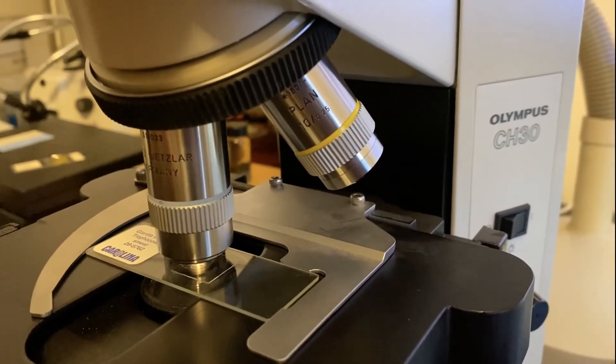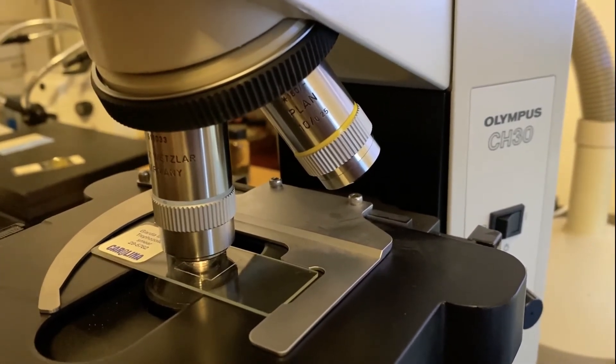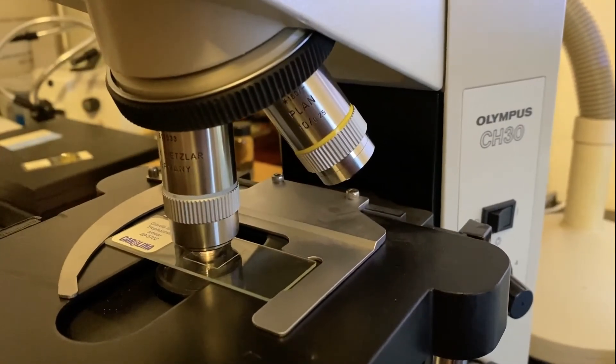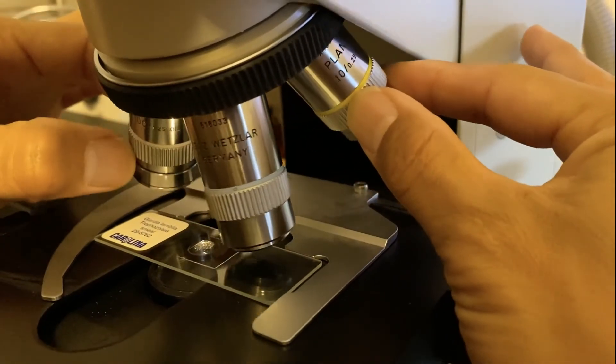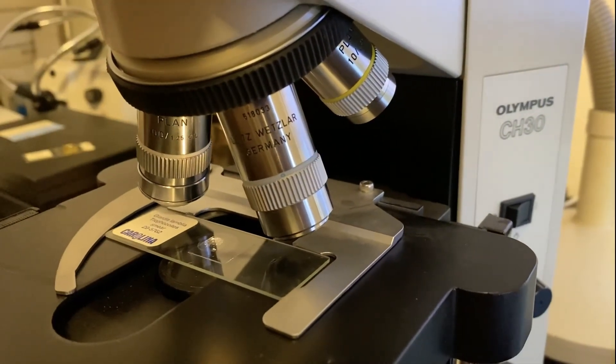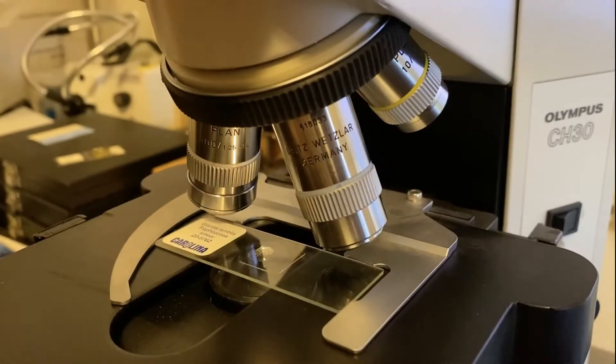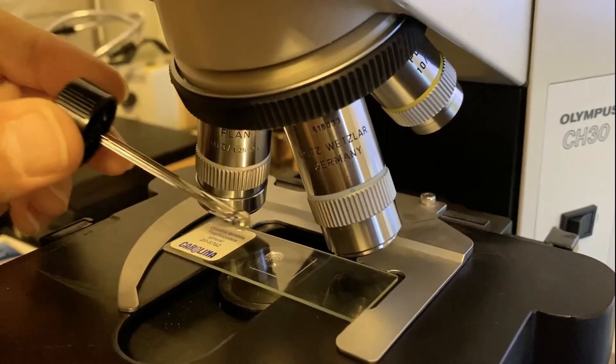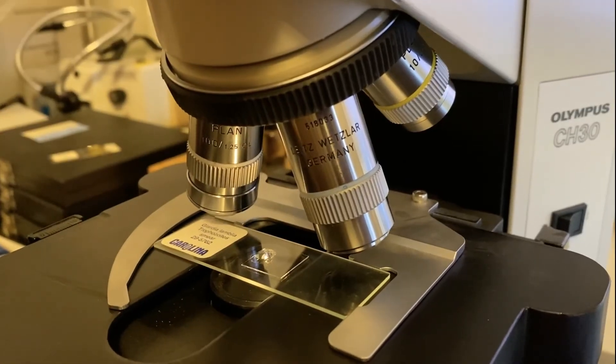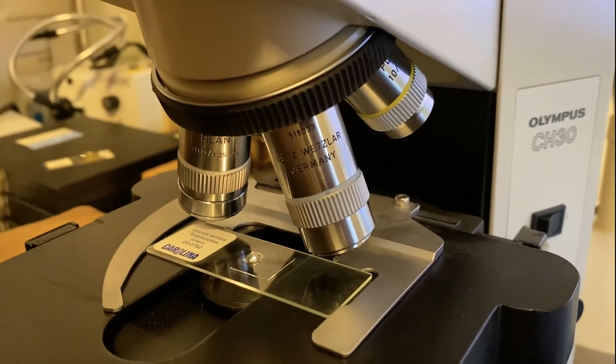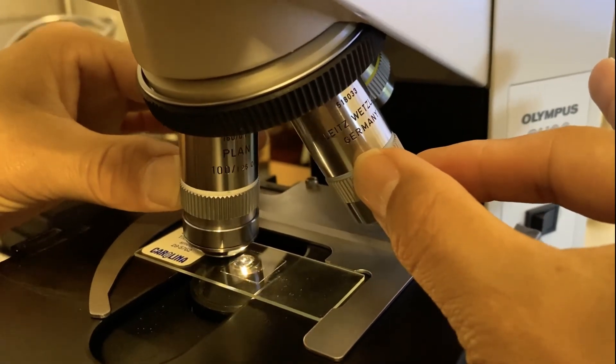This will allow us to have a sharper image if we're at higher magnification. Moving to that oil immersion magnification, what we're going to do is move this so that we are now opening that space. And I'm going to use my oil here, and I just need a very small drop just like that, and I'm trying to be very gentle about it. That's all we need. Now I can continue to rotate the oil objective, the 100 times objective, into place.